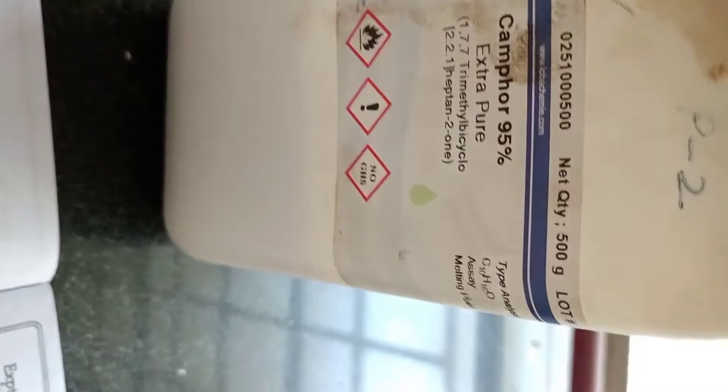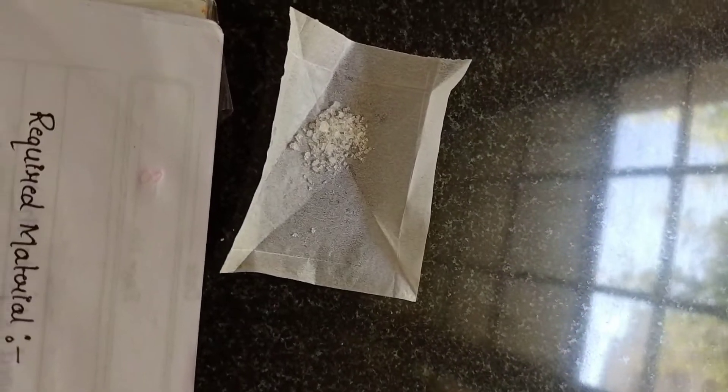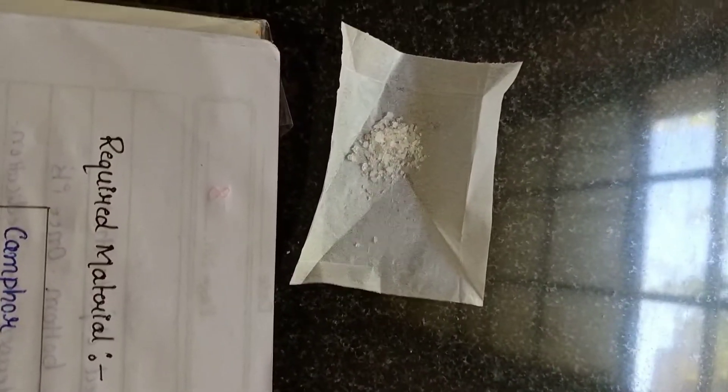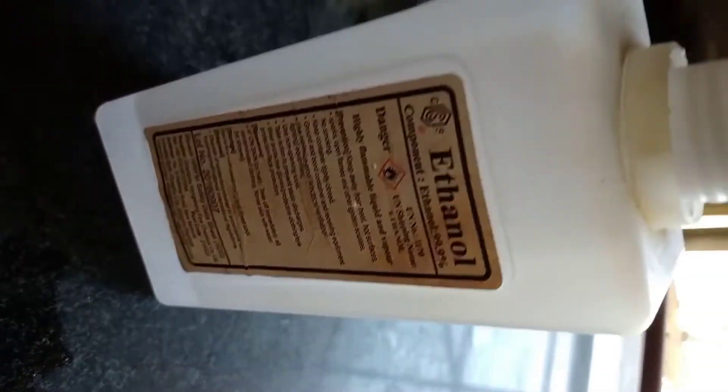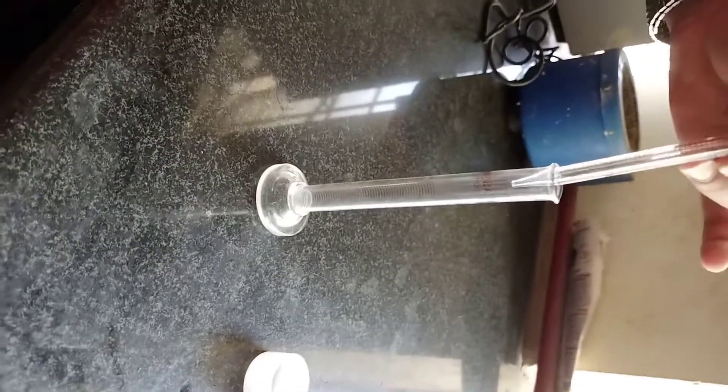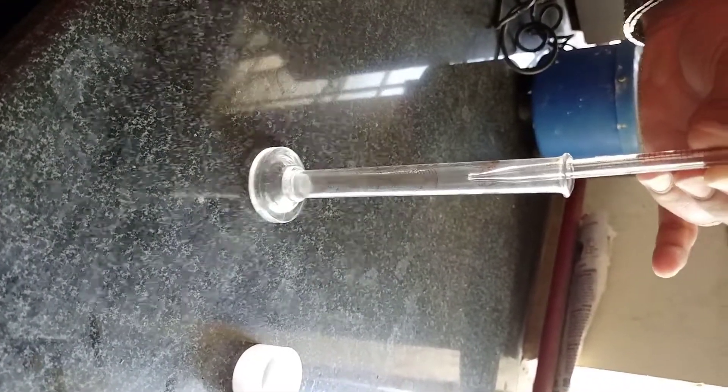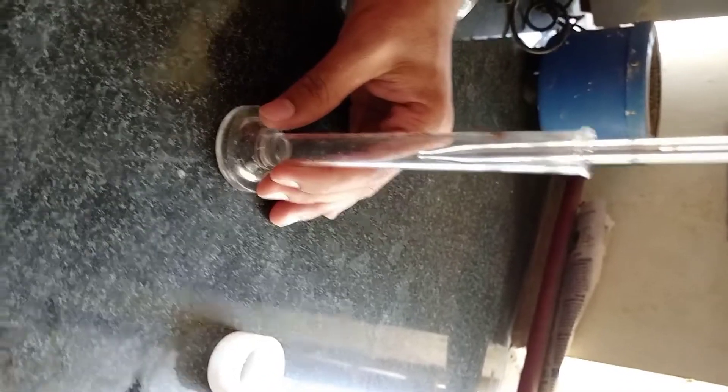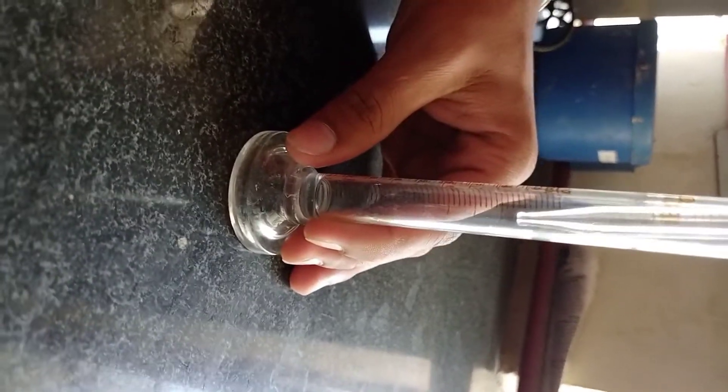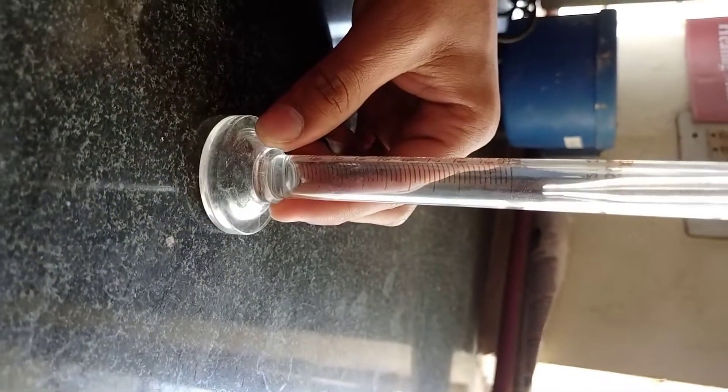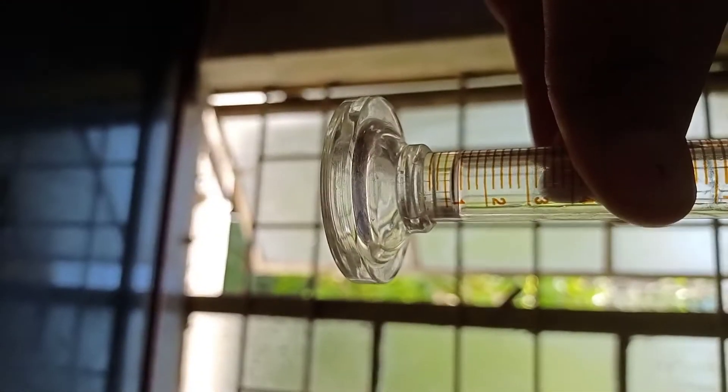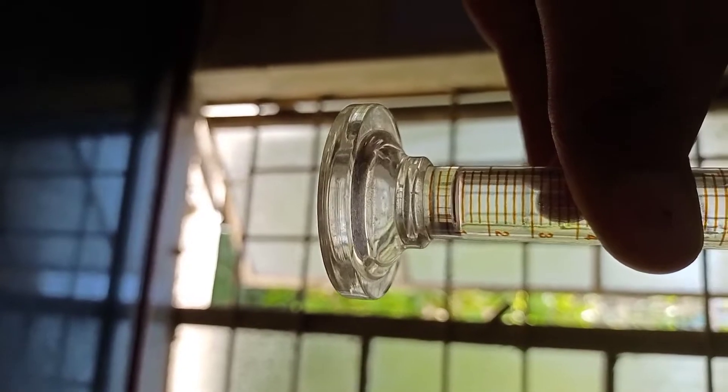Here is camphor and we have already taken 0.1 gram. Here is ethanol and we are taking 1.5 ml. You can see that this is 1.5 ml ethanol.